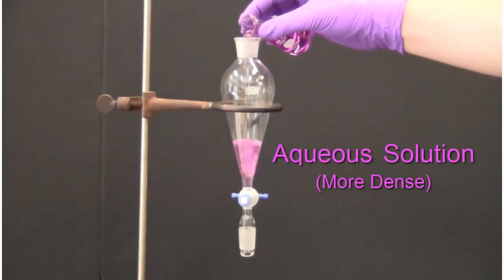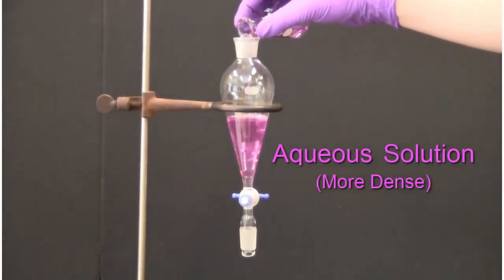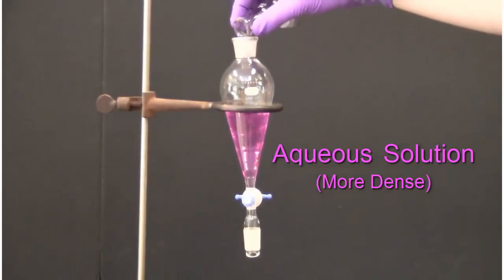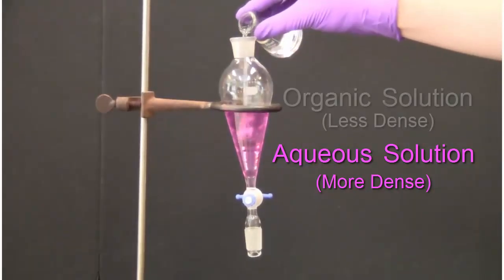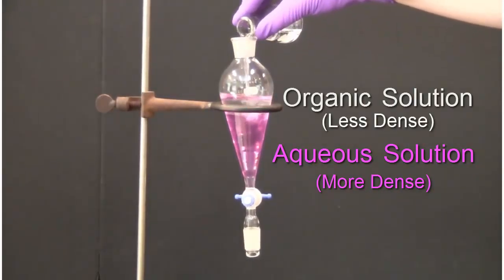The liquids are then added through the top of the funnel. In an actual extraction the solutions generally will not be colored. In this video one solution is colored for your benefit.